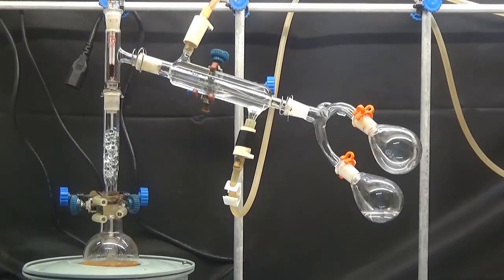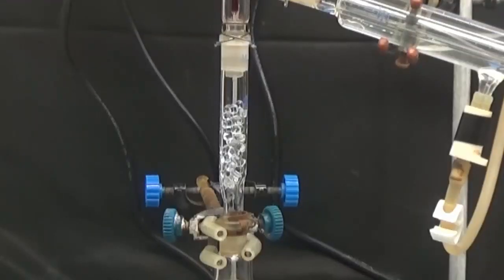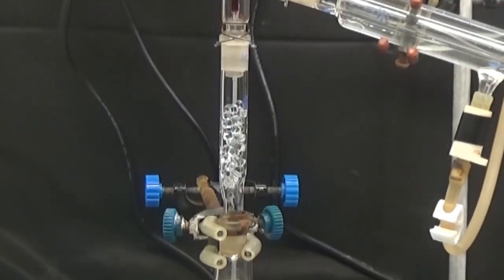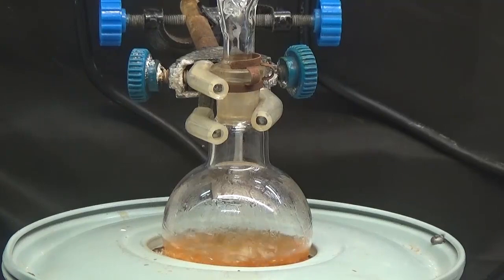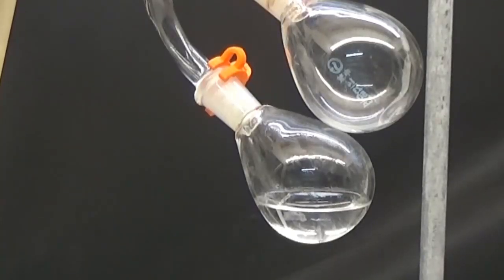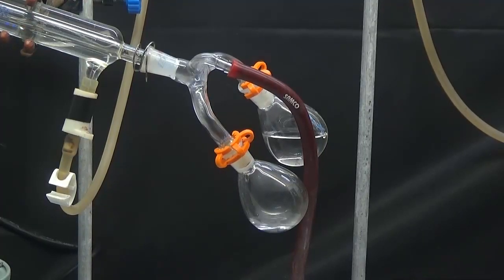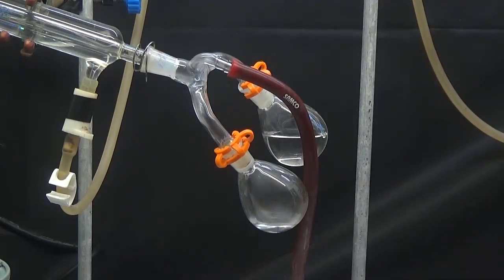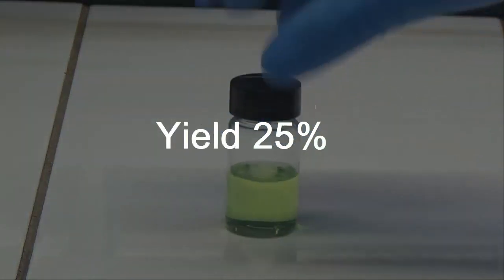The product obtained is fractionated using a column full of glass spheres. First, distillation is carried out at normal pressure, and when the temperature exceeds 120°C, the vacuum is connected and the ester is distilled. The ester has a boiling point at normal pressure of 180°C. The yield was 25%.